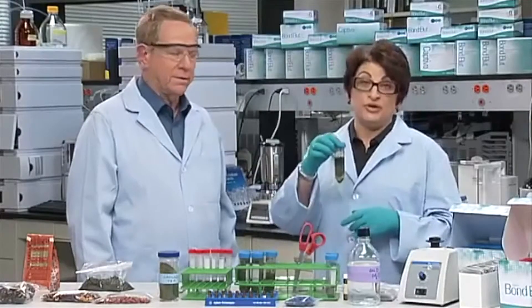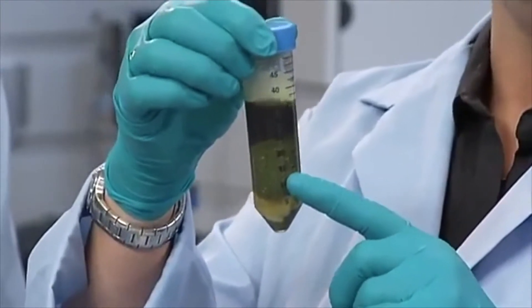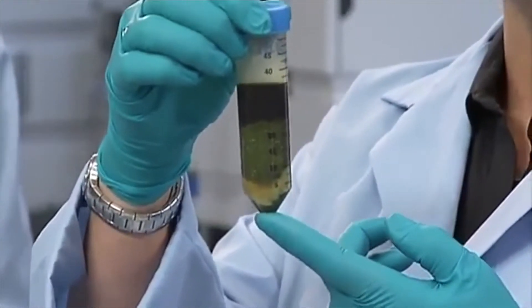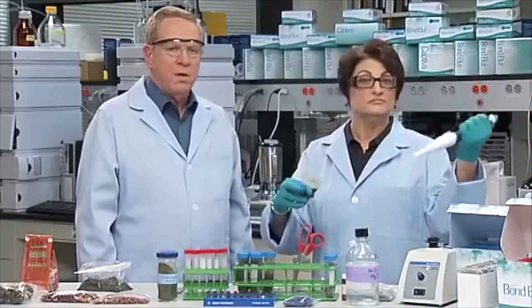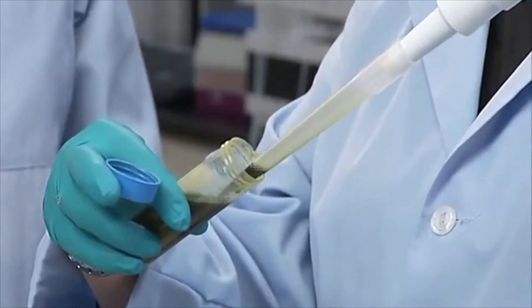The resulting sample will show three layers. The top layer is the acetonitrile partition layer containing the extracted compounds. The middle layer contains the solids from the sample, and its thickness will vary based on the original sample matrix. The lower layer is aqueous, containing the excess salts and the ceramic homogenizers. Let's take a look at step number two, which involves dispersive SPE of the extract. We will transfer an aliquot of the top acetonitrile layer containing our compounds of interest to the pre-weighed material in the dispersive SPE tube.